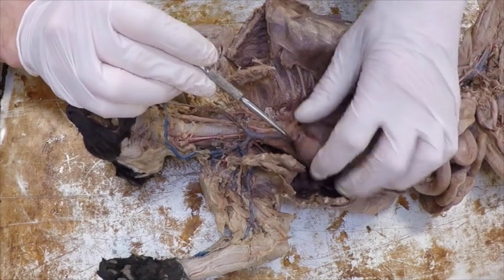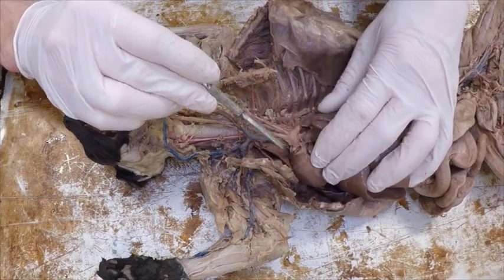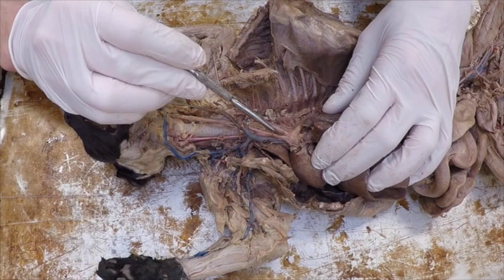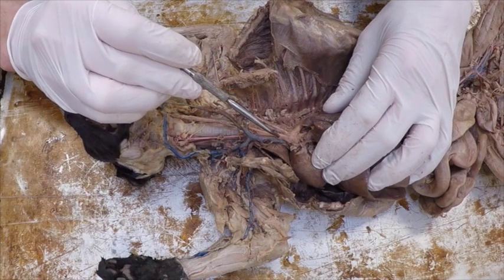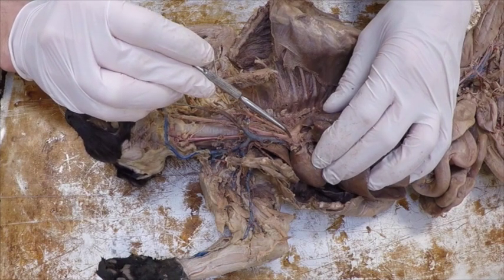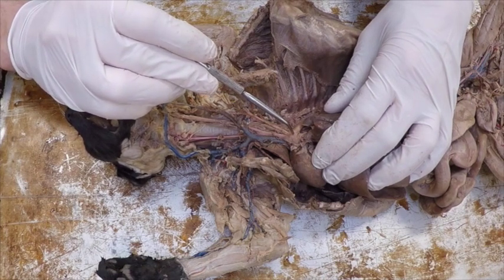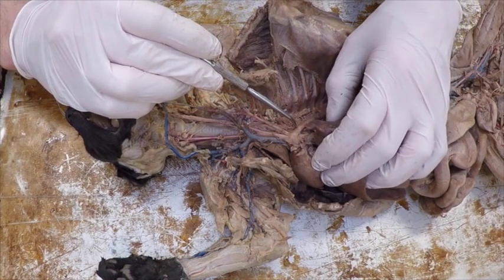Coming out of the top of the heart, and I'm kind of twisting it over, but right here, coming out of the top is the ascending aorta. Then I've got a split off here called the brachiocephalic, and this is my aortic arch coming around the top. Then is the left subclavian, and then I've got my descending aorta going down that same main trunk.